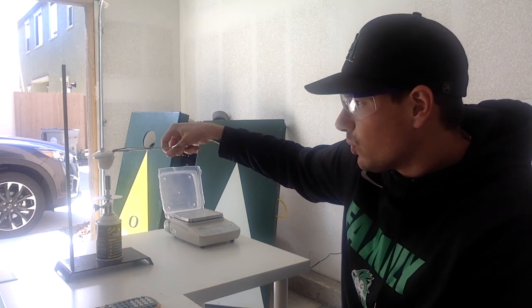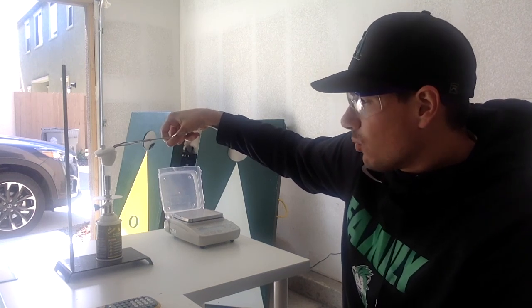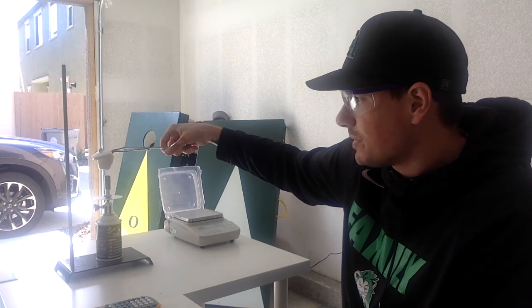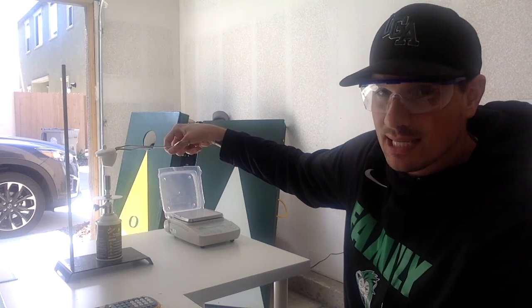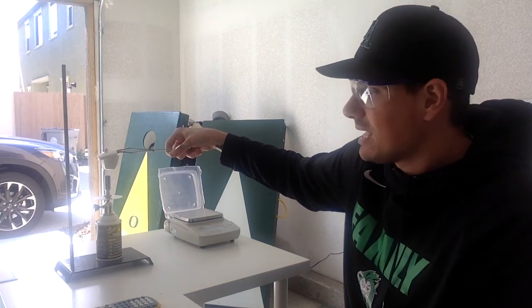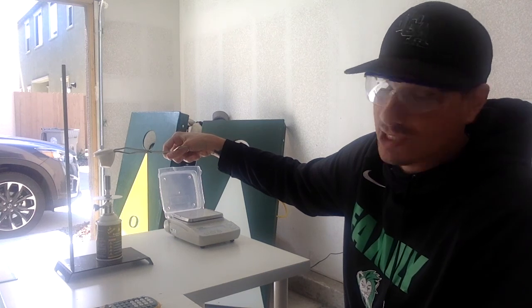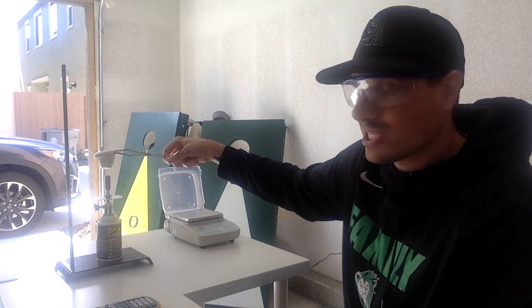Now what we're going to do with these masses here: since we found the mass of the magnesium we put into this, as we combust or burn this magnesium, oxygen in the air is going to attach to the magnesium, creating that magnesium oxide and that white powdery substance. We're going to find the moles of magnesium we put into this and the moles of oxygen that attach to the magnesium to make that magnesium oxide. And hopefully we have a 1-to-1 ratio. Using our ionic formulas, magnesium has a charge of +2, oxygen has a charge of -2. So it forms that MgO compound, that 1-to-1 ratio. Let's see if we actually get those results or not.